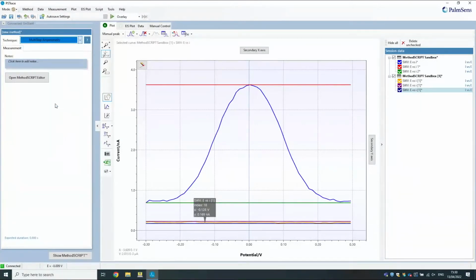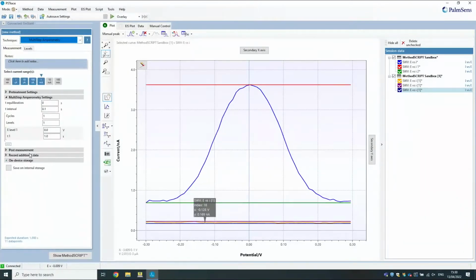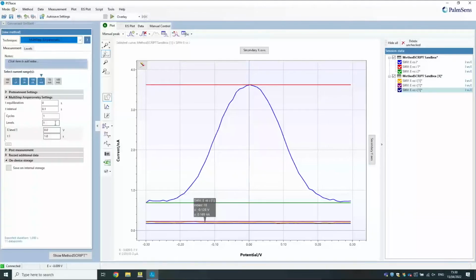Mixed mode will be in the next version, I believe. Yeah, for the EmStat4M, yes. But I believe you can already do it with multi-step amperometry, for example.